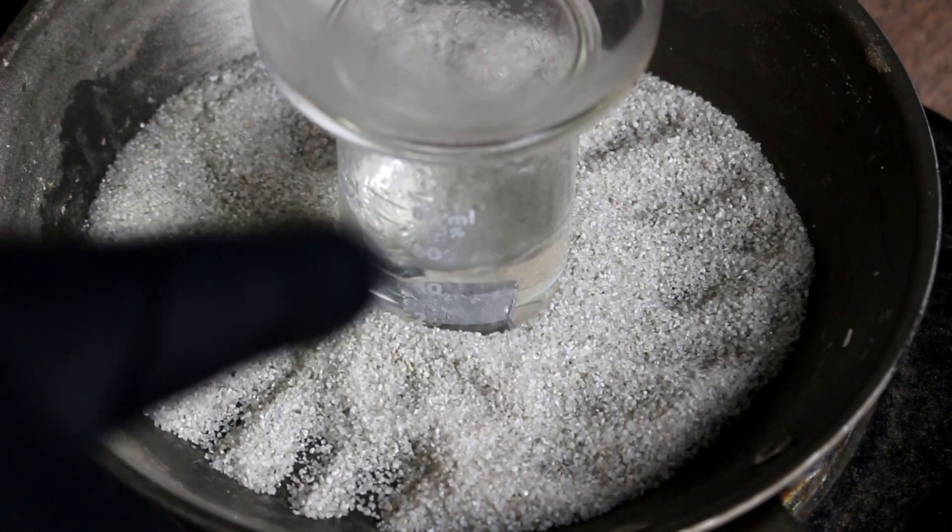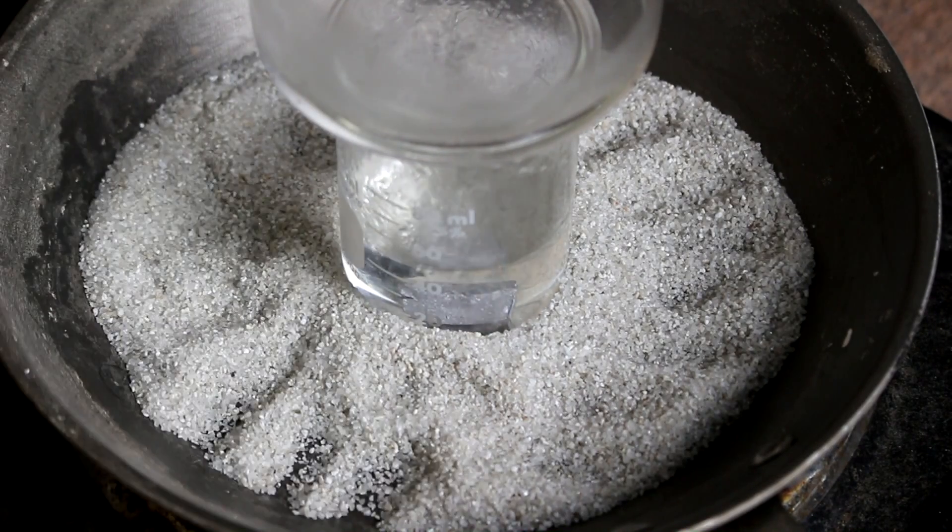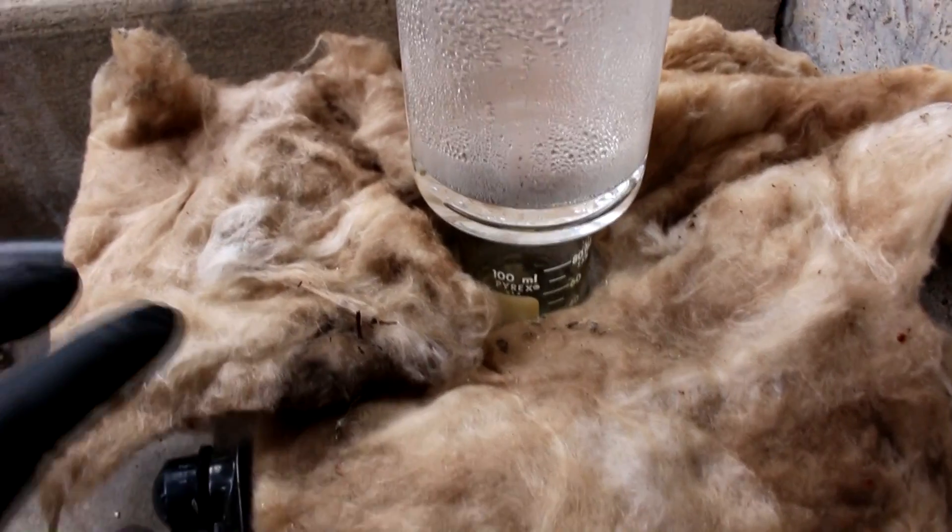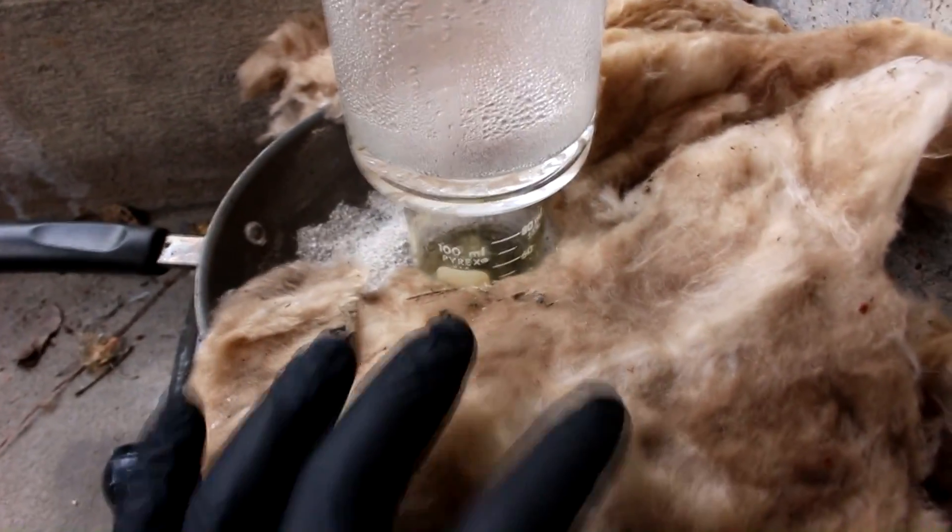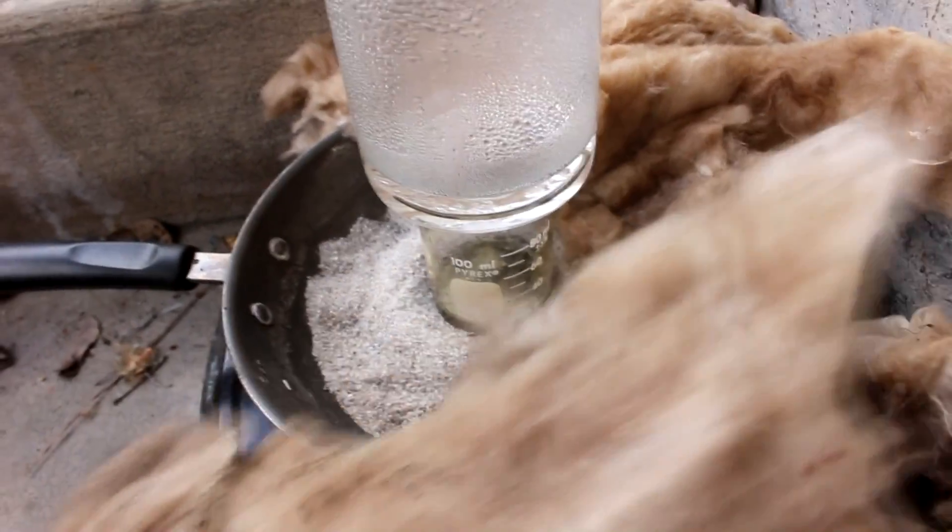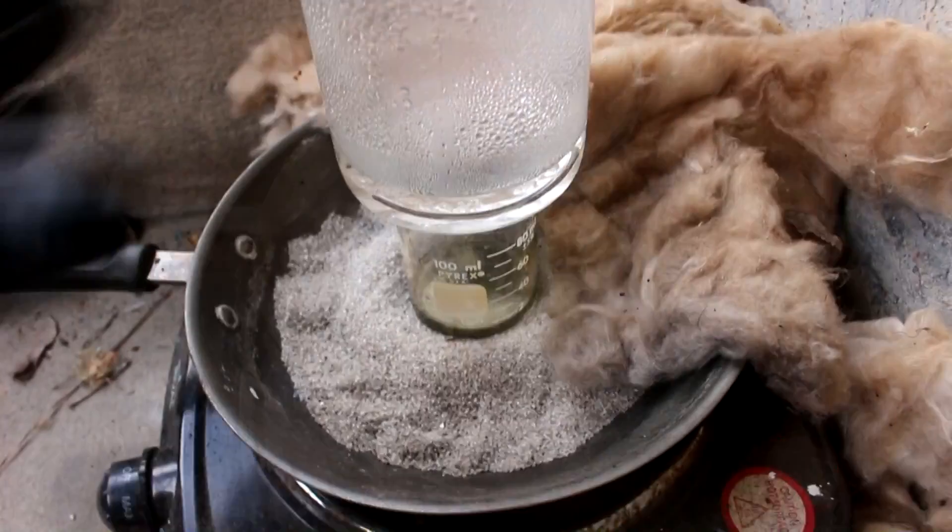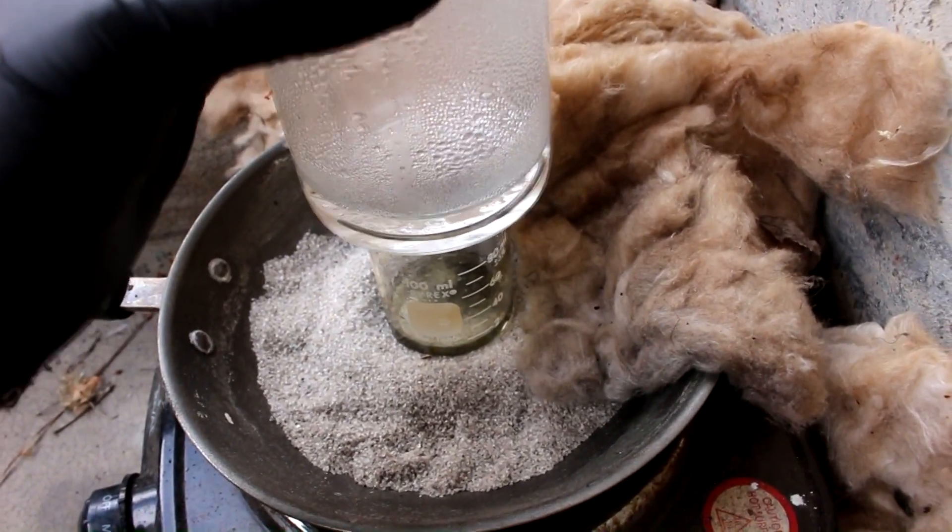I might eventually cut this ingot in half just to make it go a little faster. There you go. So here we are about two days and some change since my last cut. You can see I put some fiberglass in here to maintain some heat. I think most of it is dissolved now. Let's have a look.